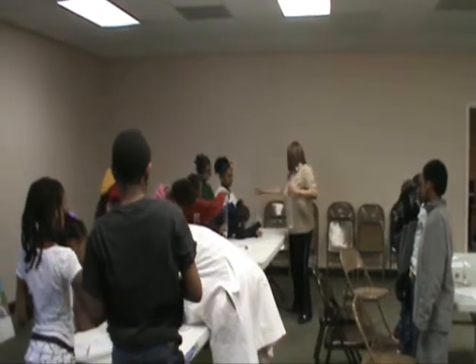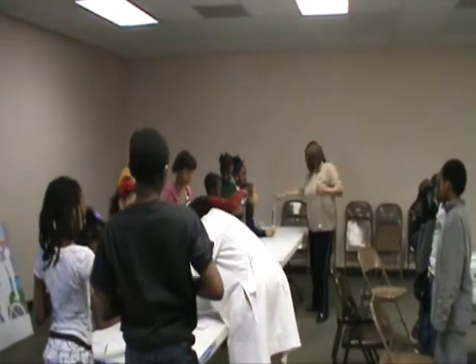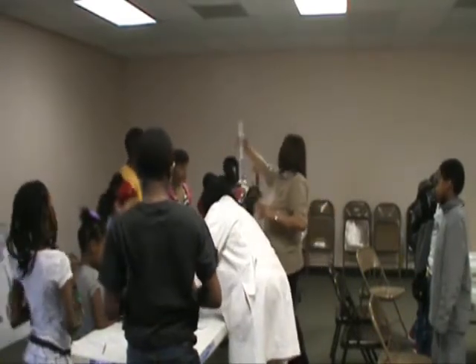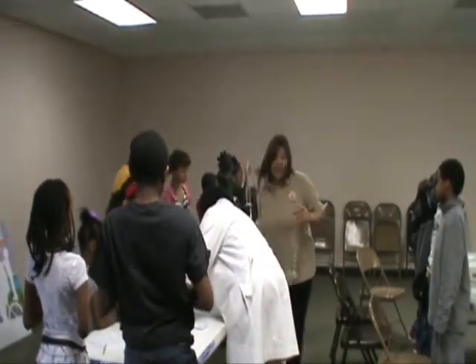Okay, let me see, ladies. Now, it should be below 250. Almost. Very good, girls. Let me check yours. So, now, I don't want it to be perfect yet. I'm going to show you how to make it perfect.